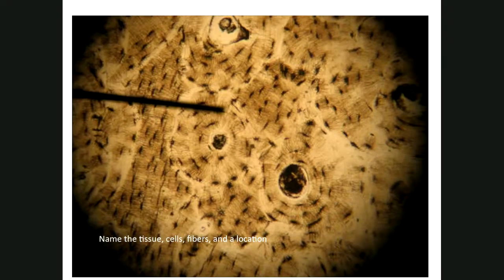Next one, hopefully nobody's going to get wrong. This is bone tissue. Again, giveaway color. No other tissue is dark. You have these round structures there, which we're going to study in chapter 6 when we look at bone. We have the little nuclei of the osteocytes, and even though we don't see it, we know that there is lacunae in there. We know there are fibers. The fibers are going to be collagen fibers. So we have collagen fibers, osteocytes, calcified matrix, these round structures. This is bone tissue.